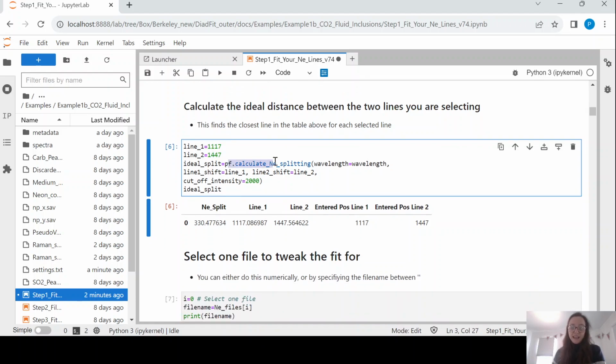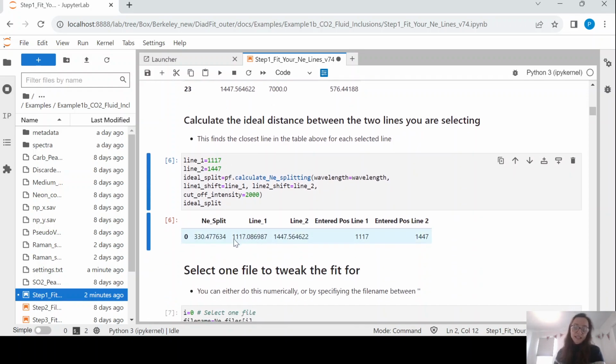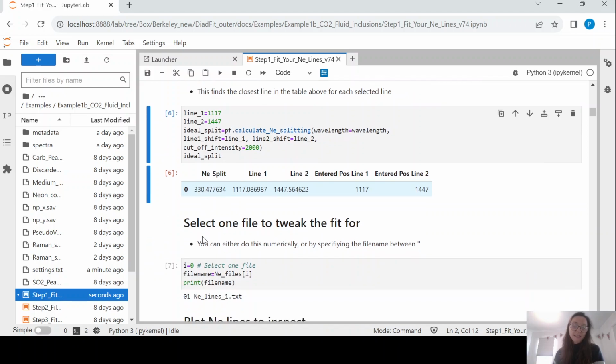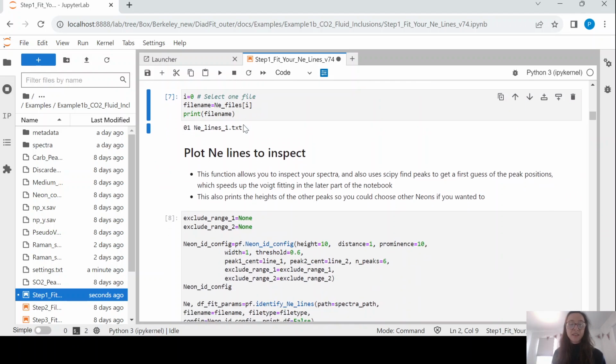What we're basically saying is give us the ideal splitting for those lines, so the ideal distance between those 2 neon lines. You don't have to type the exact line number, it's basically going to find the closest line number to the number you put in. So you can see the ideal value of this line is 1117.08, 1447.56, and a corresponding splitting of 330. You're then going to select a single neon file, okay, and this allows you to tweak the peak fit. So here we are just taking the first file.